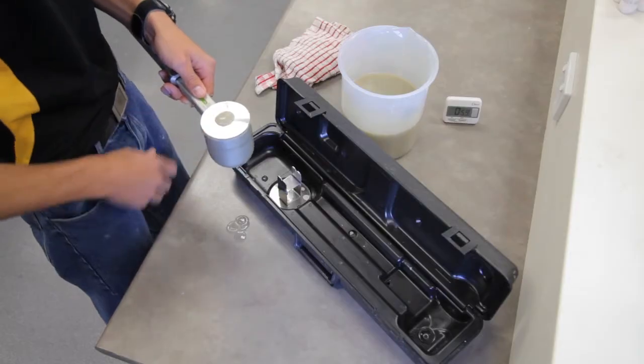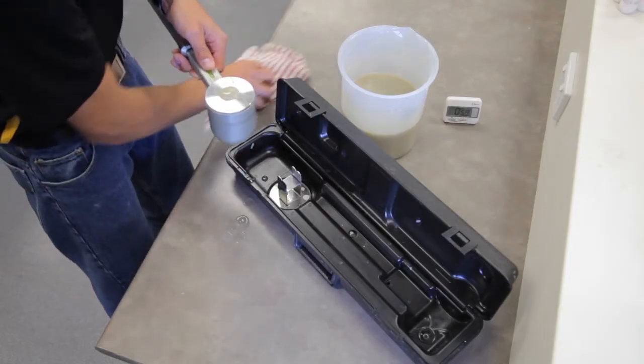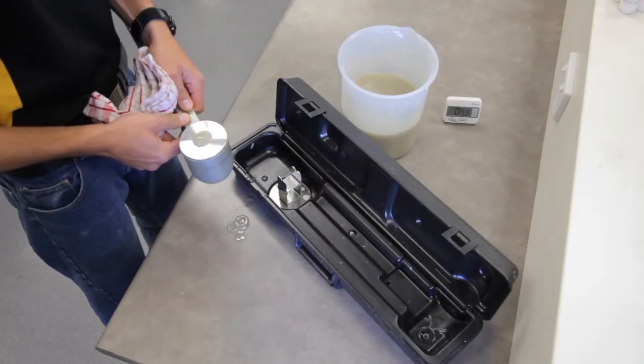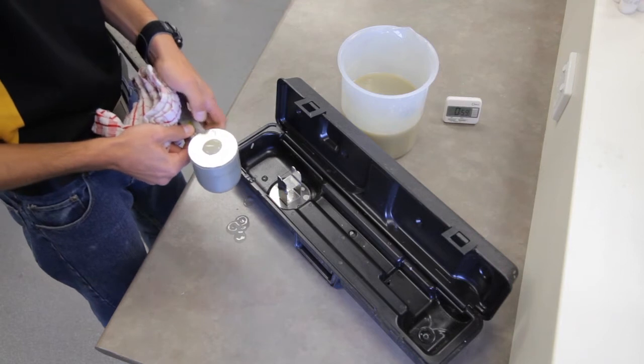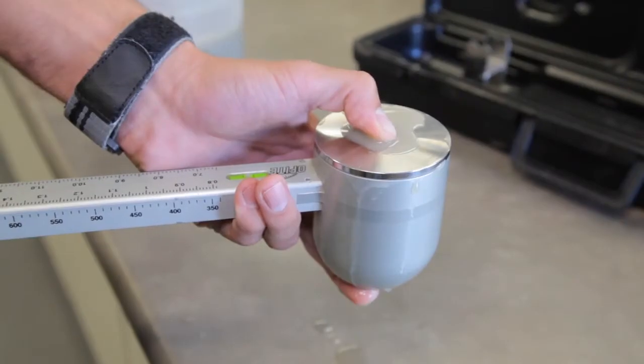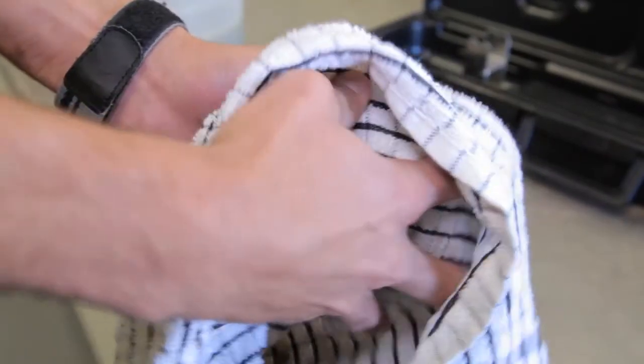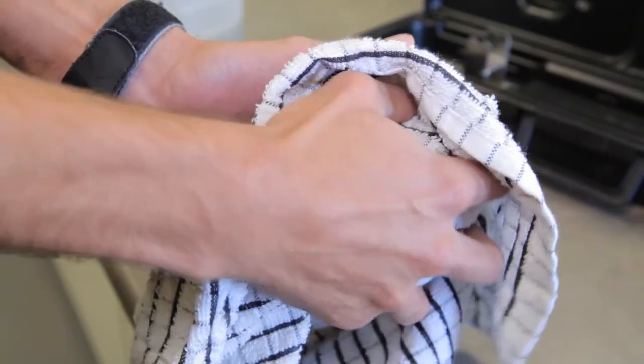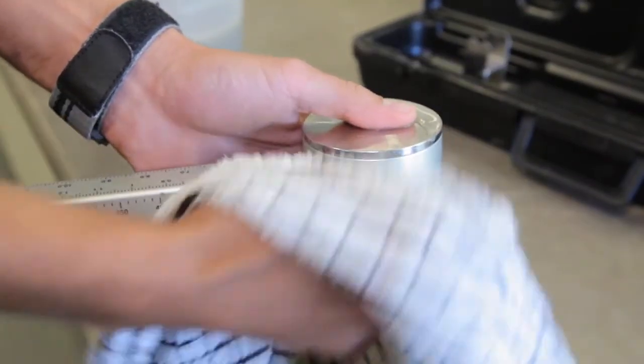After the lid was placed on the chamber and the fluid has overflowed from the hole, close the hole with your finger and wipe the chamber, lid and arm clean.